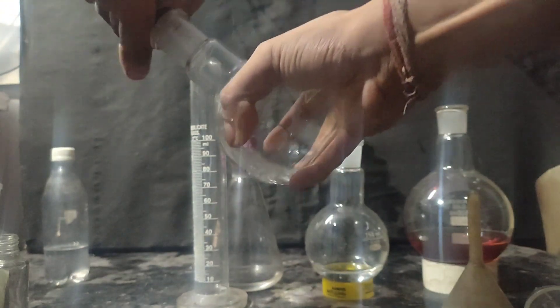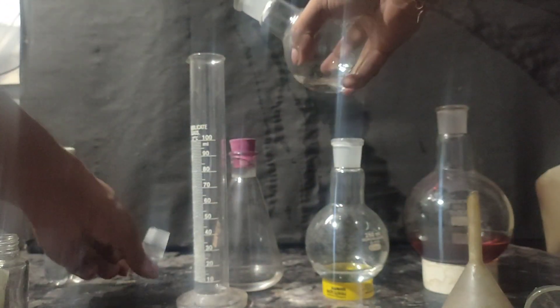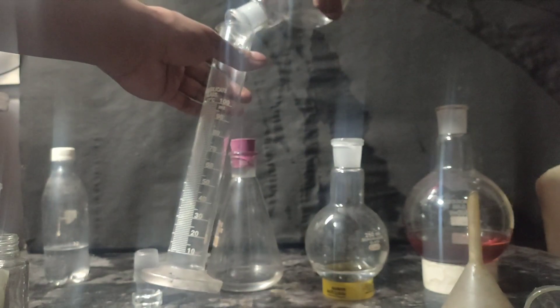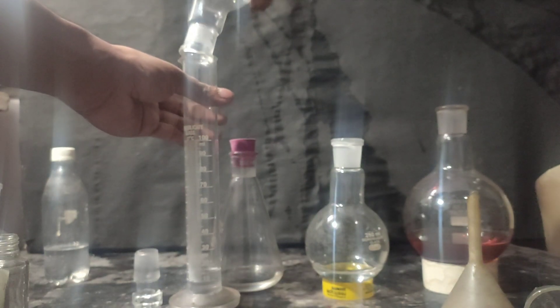This is the second fraction that came around 65 to 85 degree celsius. And it had the lowest volume of all the four fractions. That was around 15 ml.